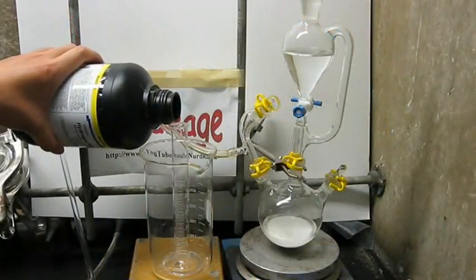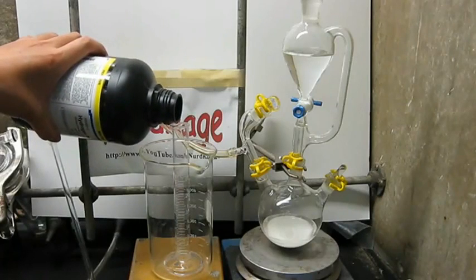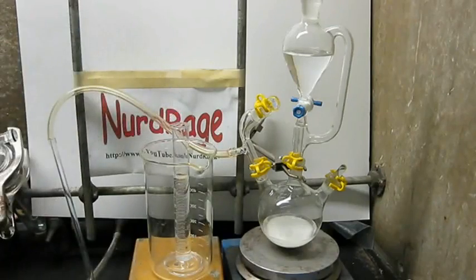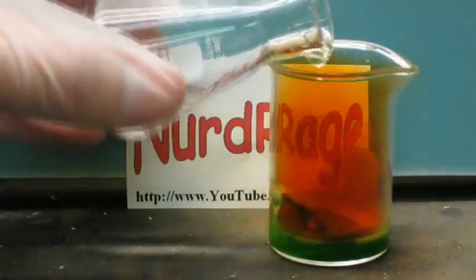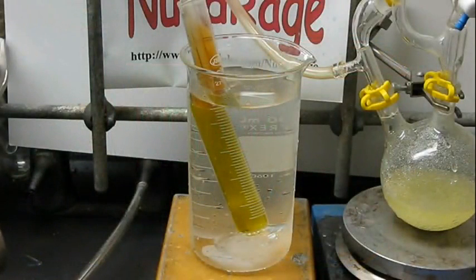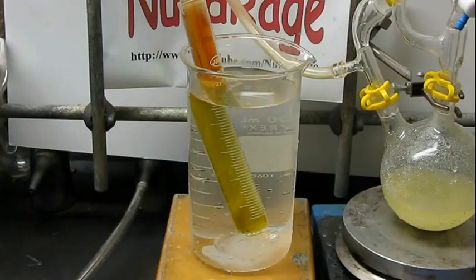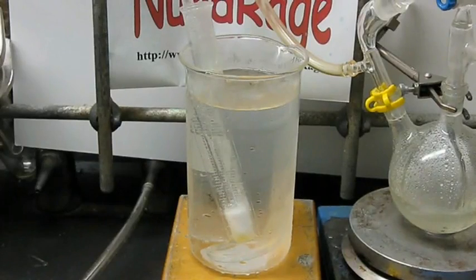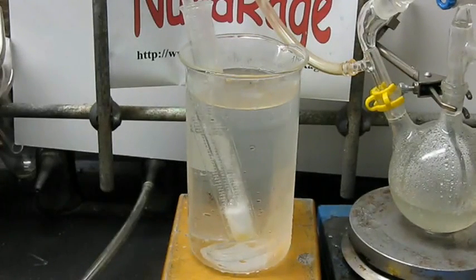Now I'm using hydrogen peroxide as the oxidizer because it's cheap and readily available, but it doesn't give a high yield or a decent concentration of acid. A better oxidizer is the concentrated nitric acid made from the first two methods we showed in our nitric acid video. A reaction with sulfur dioxide will produce copious amounts of nitrogen dioxide. The advantage of this is that it indicates when the reaction is complete. When it goes completely clear, all the nitric acid has been converted into sulfuric acid. You can then swap out more nitric acid to continue the reaction. Hydrogen peroxide does not give you this indication.